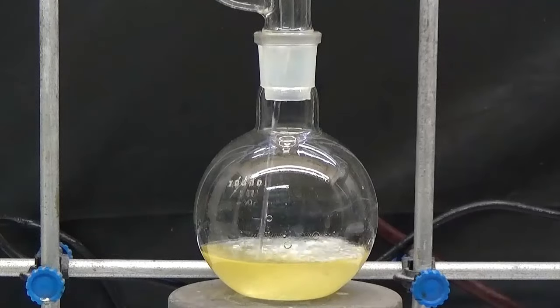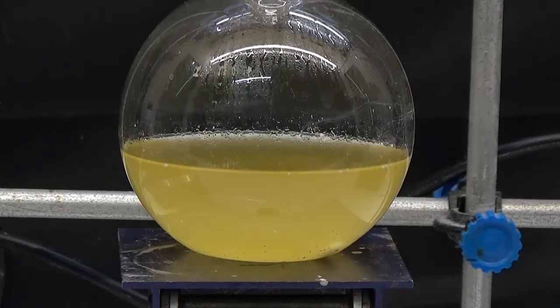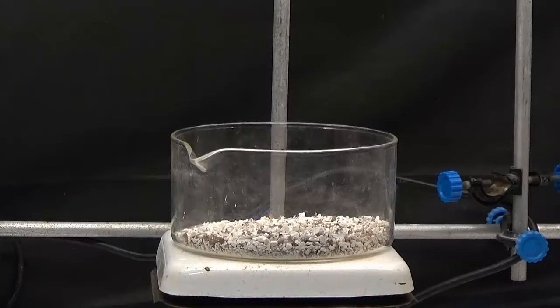After these operations most of the dichloromethane was distilled for recovery and the resulting oil was removed. The degreased seeds are dried in a hood or outdoor on a hot plate at 50 degrees.